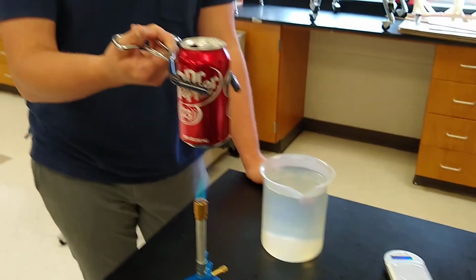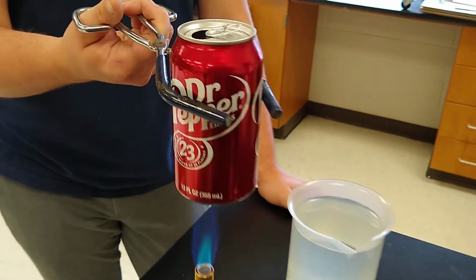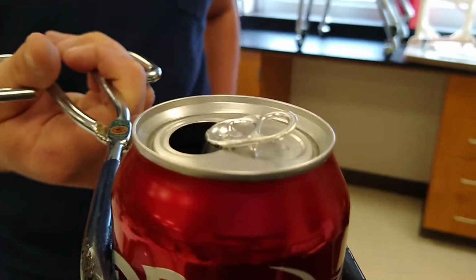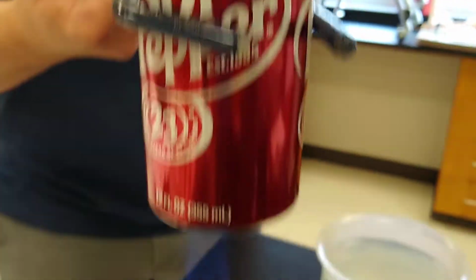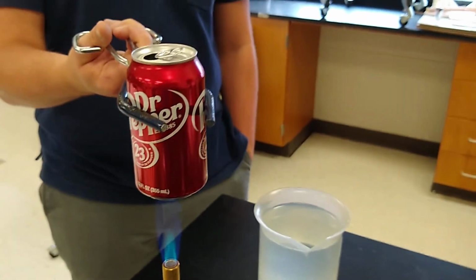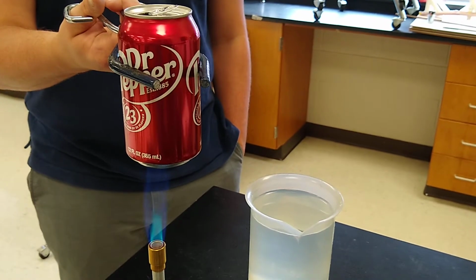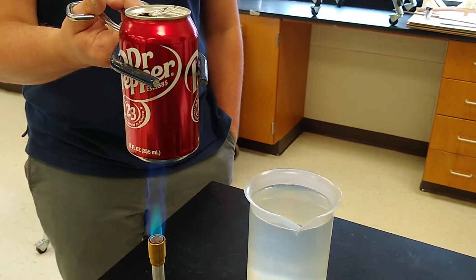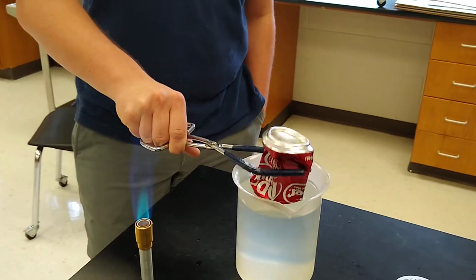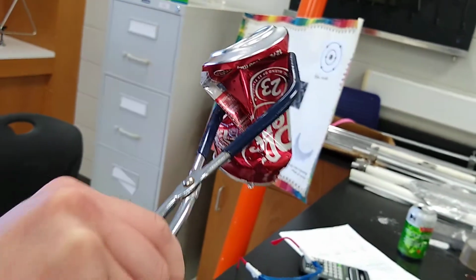All right? Now, next thing we're going to do is we've got a raging boil. Listen to this. See the water vapor escaping? Okay, we're really on the flame here. So what we're going to do is take this and we're going to immediately cool it off by flipping it upside down into the water. All right, 3, 2, 1. Nice. This is what happened to our can, people.